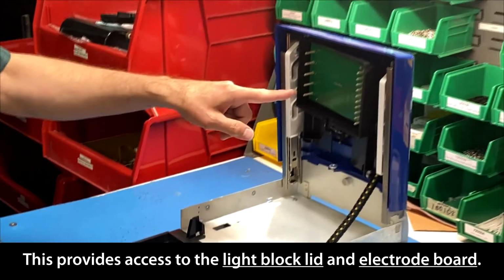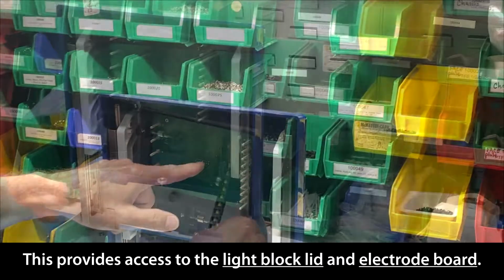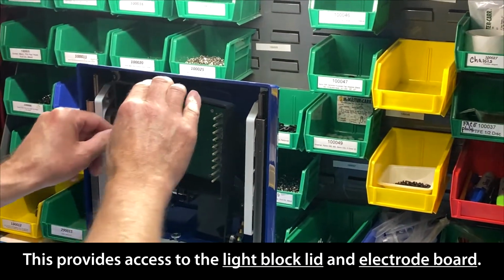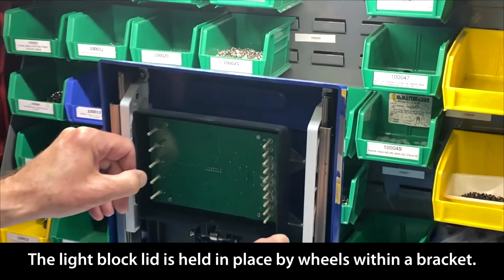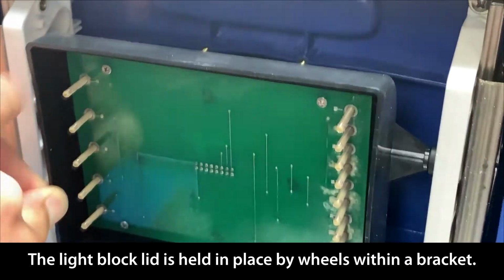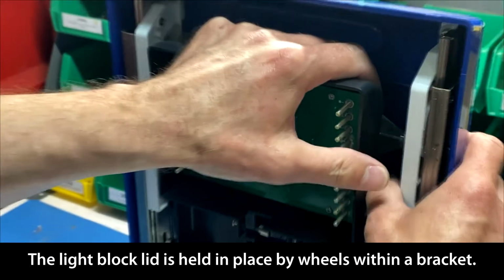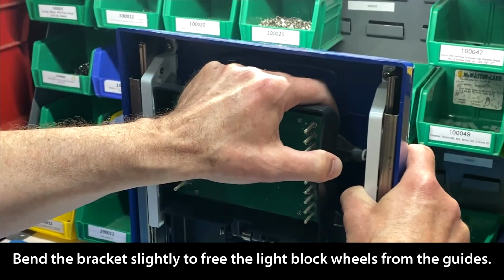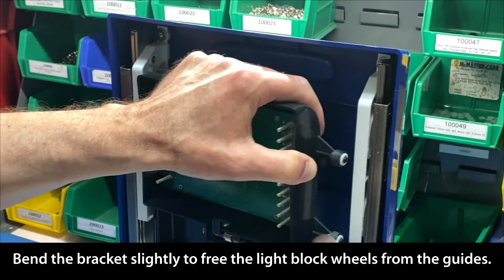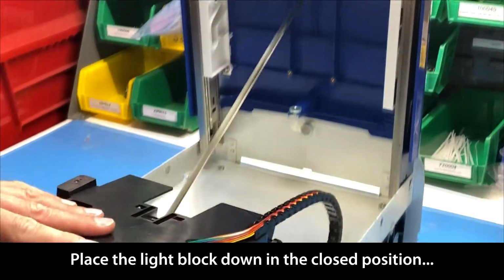Now underneath here, you've got your light block lid and your electrode board. What I want to do is take out this light block lid. The only thing holding the light block lid in is your 4 wheels here. There's nothing else holding that in. So the way you get your light block lid out is you just bend your guides a little bit, take out those 2 wheels, and then on the other side just pull them out, and your light block lid is disengaged.